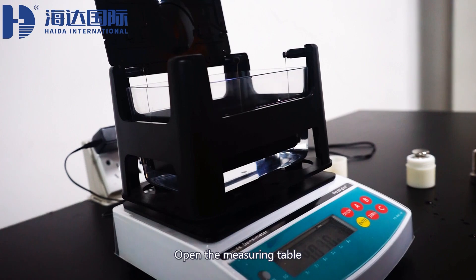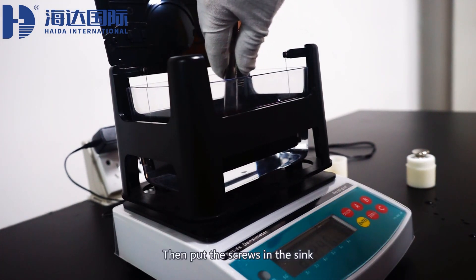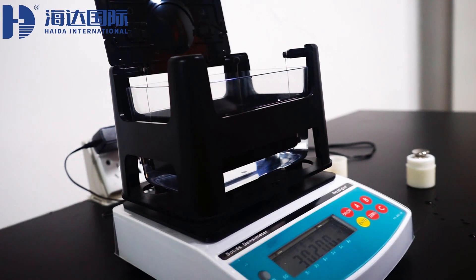Open the measuring table, then put the screws in the sink. Click on the enter button.